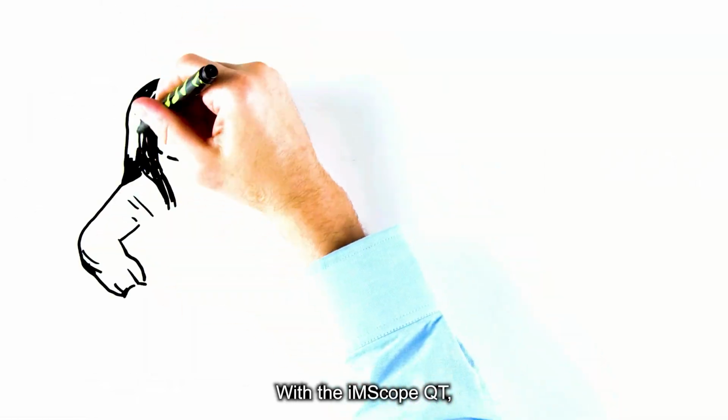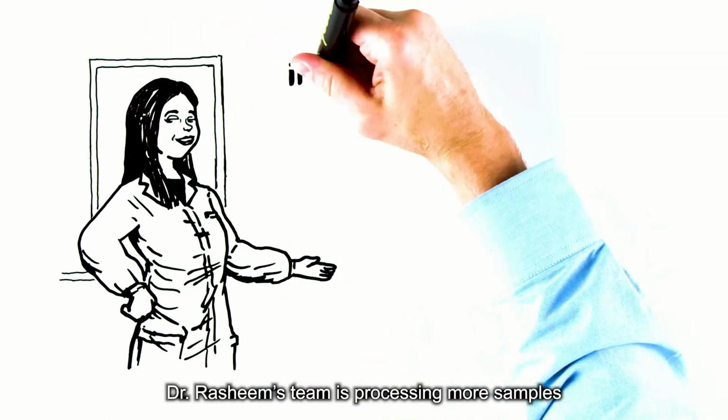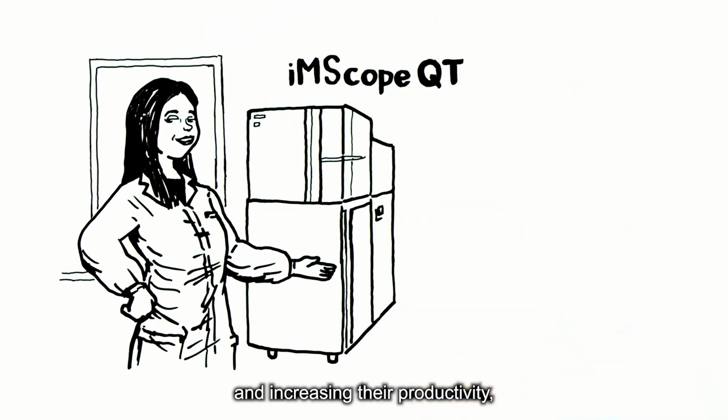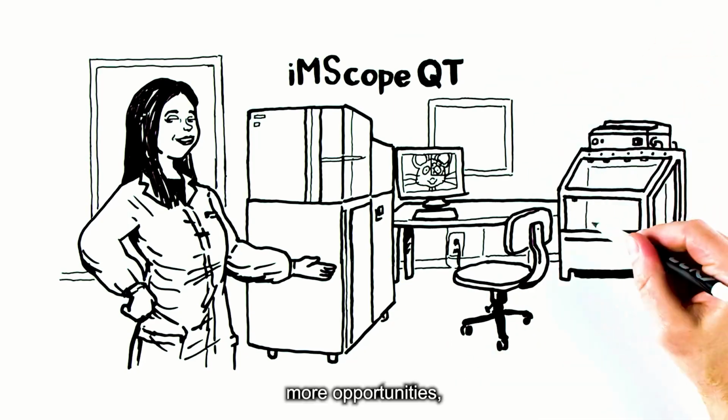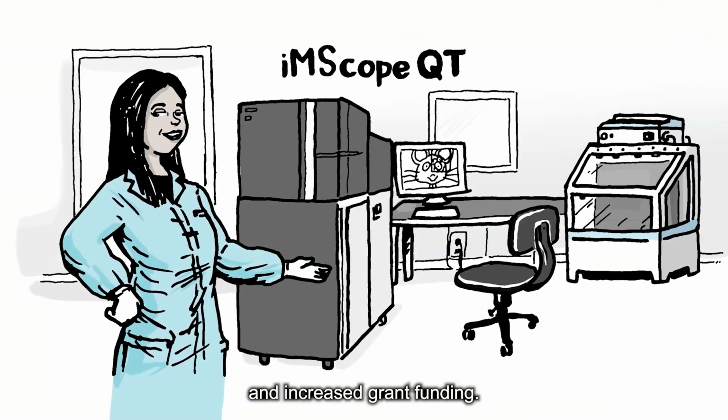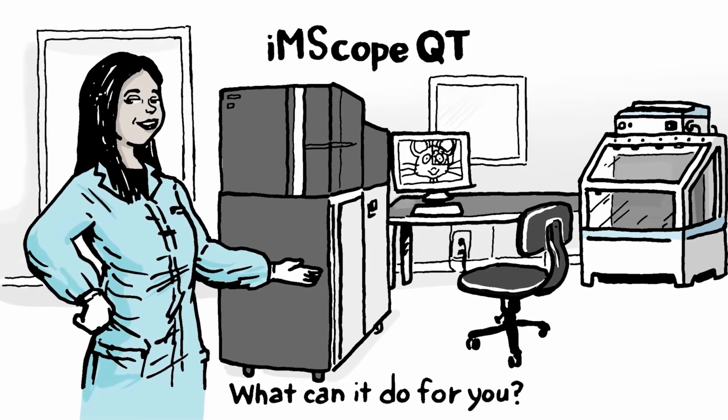With the iMScope QT, Dr. Rashim's team is processing more samples for collaborators and increasing their productivity, resulting in a higher publication rate, more opportunities, and increased grant funding. What can it do for you?